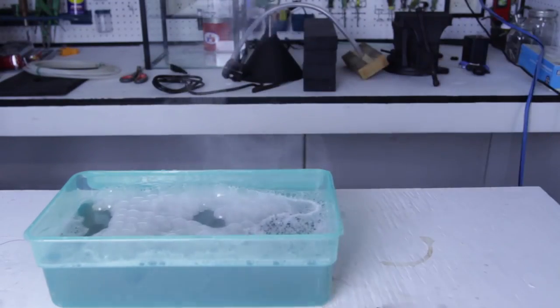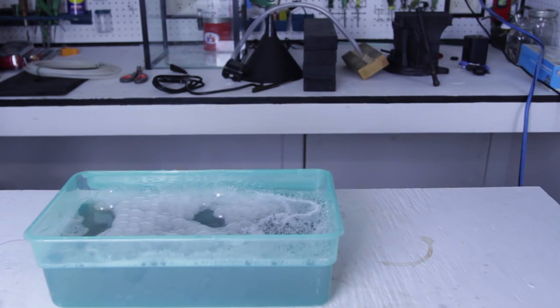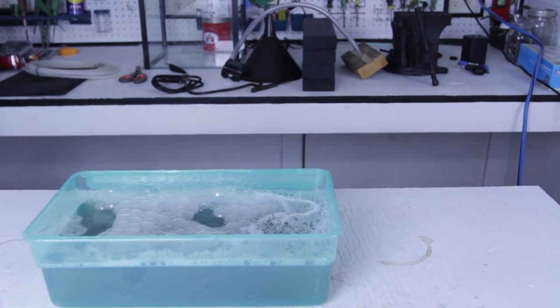Put this away somewhere. So now I'm going to light those bubbles up, and see what happens.